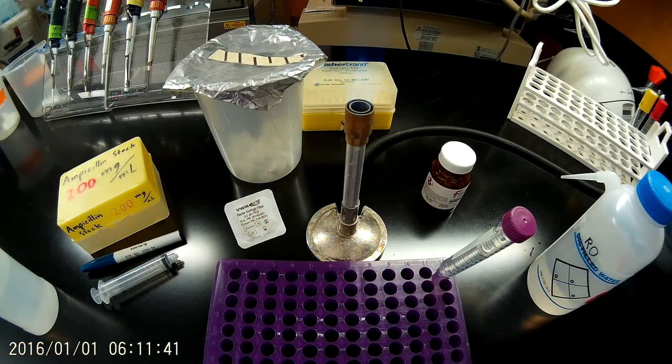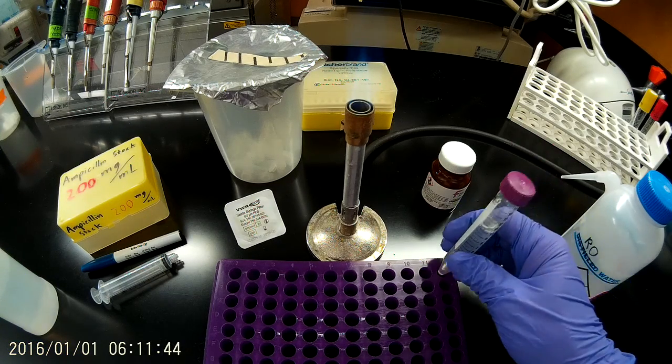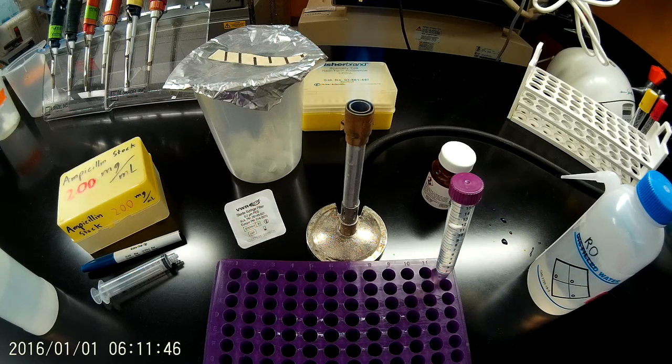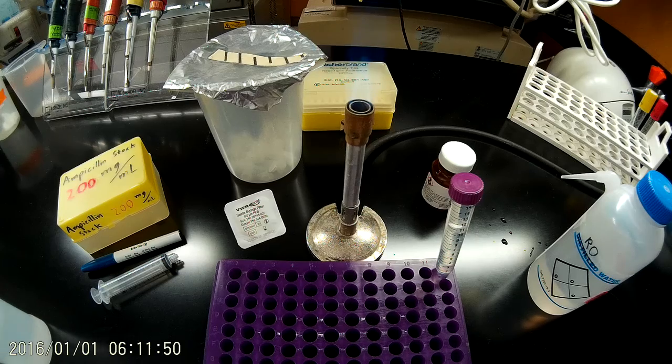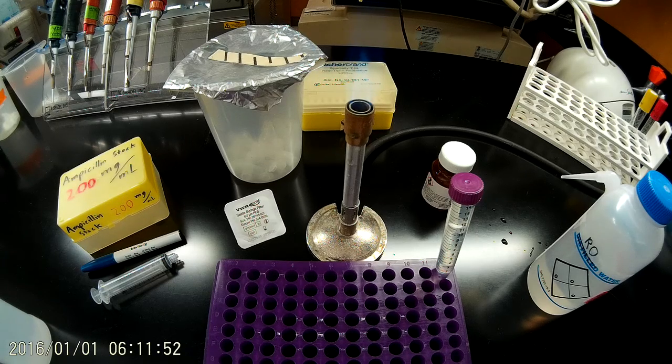Now I'm going to want to pull out 2 mil tubes that I'm going to freeze this stock solution in. So remember, when you freeze water it expands, so we're actually going to need more than 5 2 mil tubes. I'm going to pull out 7.